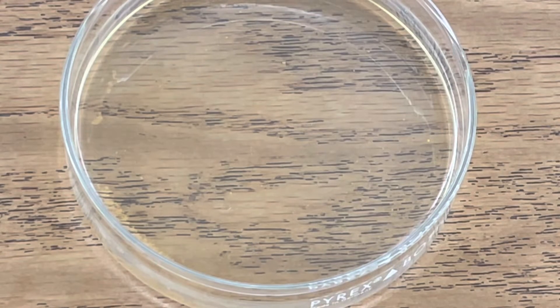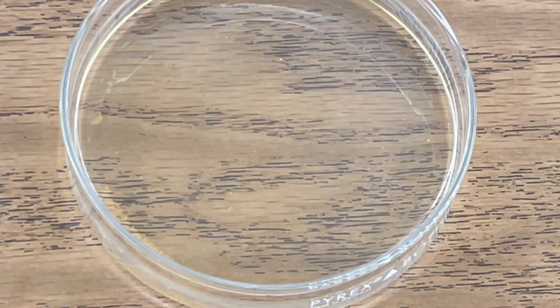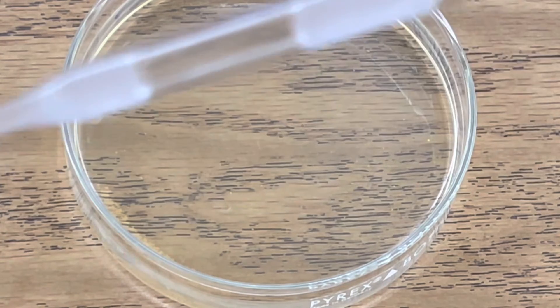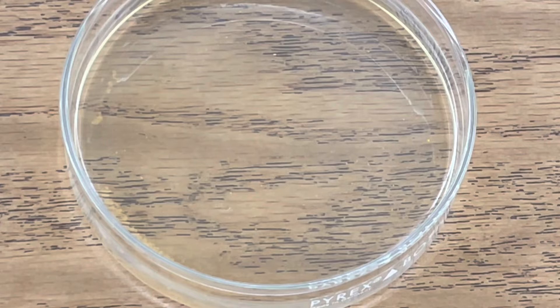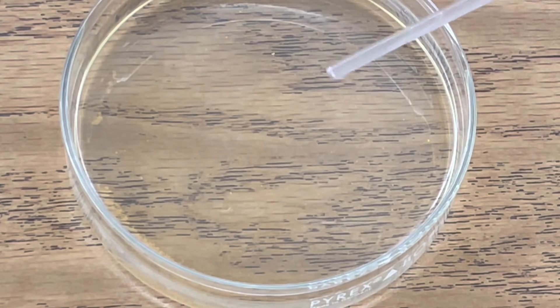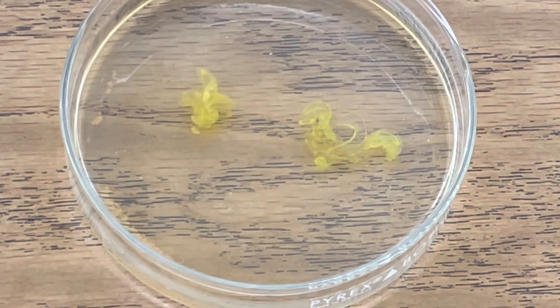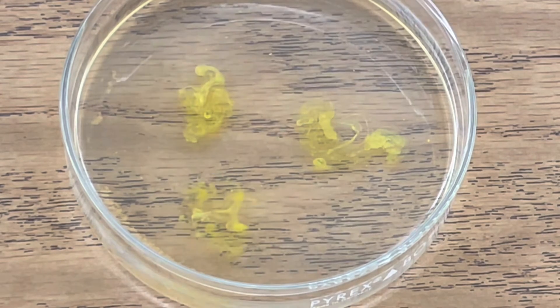Once both solutions are aqueous, ready to combine them in this double displacement reaction. This is my solution here of sodium sulfide and this is my solution here of cadmium chloride. When I combine them the metal ions will trade places and my cadmium chloride will become cadmium sulfide in this precipitation reaction. And that yellow precipitate is insoluble and forms instantly when I combine the two.